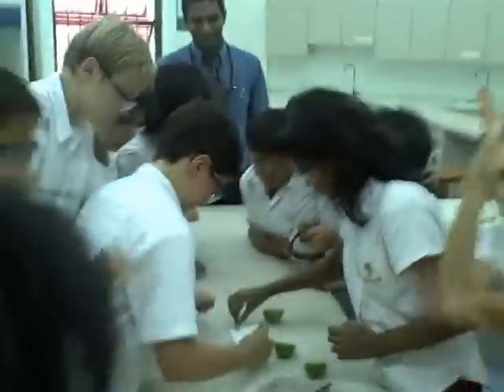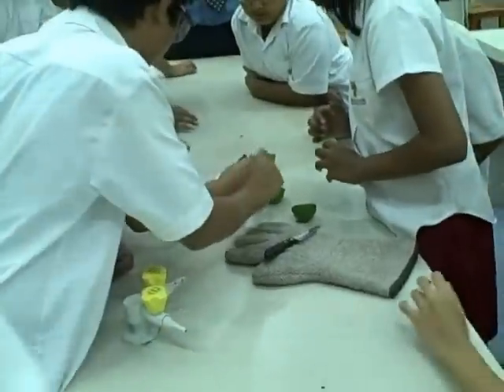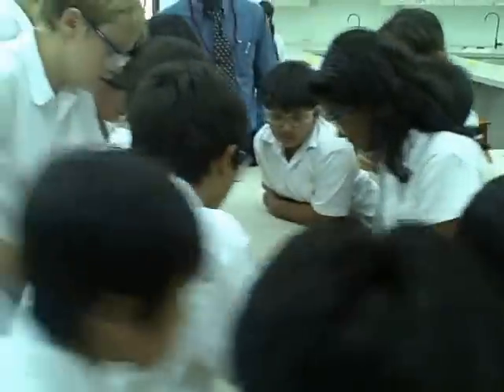So gross. And I got it on video. Yes. It's really coughing. You put in a lot of things. It was going to be big. I'm trying to not die yet. I know, it's stinky. Yay. A second. Okay, I'm alright.